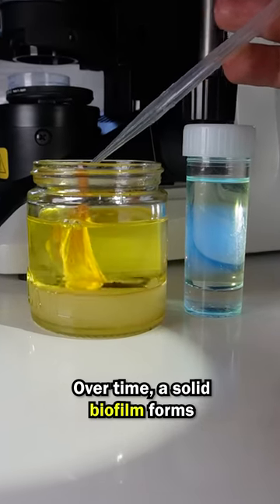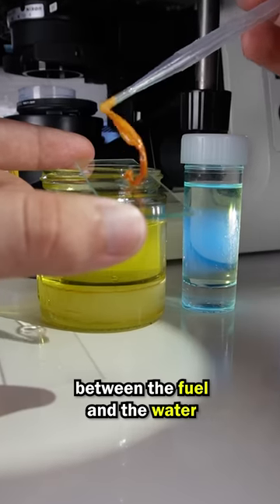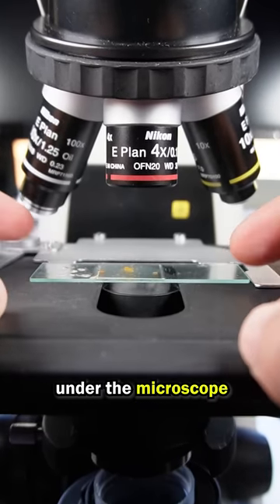Over time, a solid biofilm forms between the fuel and the water. Let's take a look at our fuel friends under the microscope.